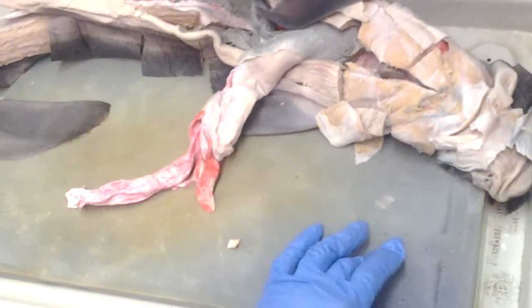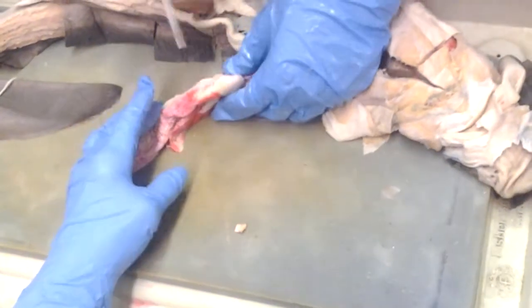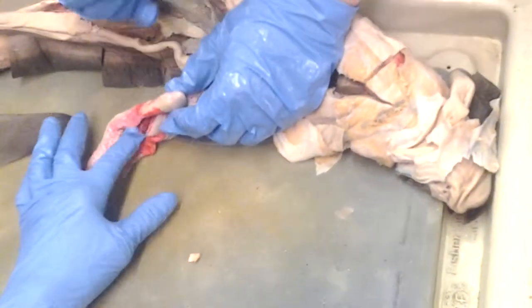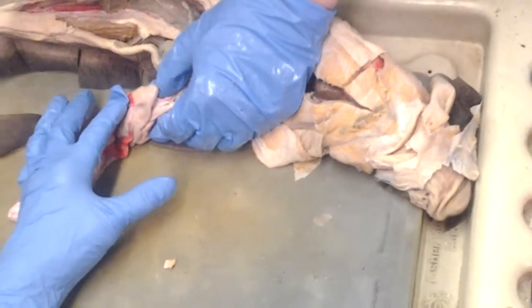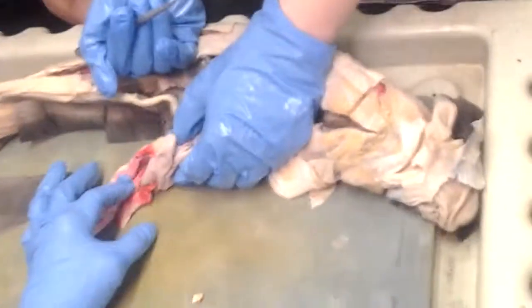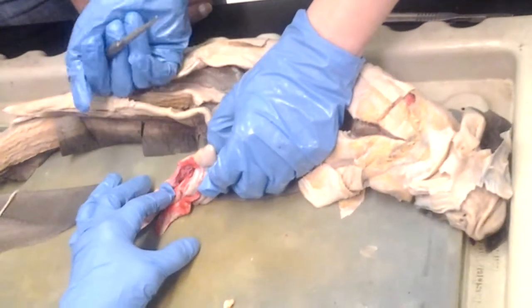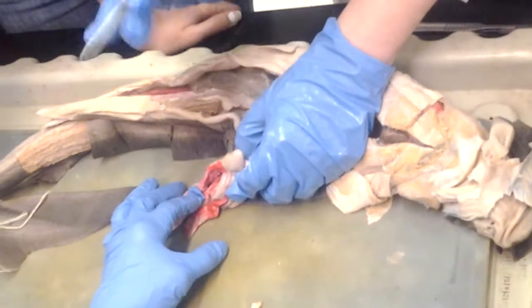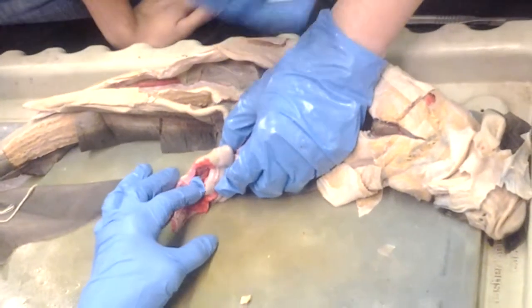Yeah. No, but the pancreas. The pancreas on the stomach, not on the intestine. Well, the pancreas is on top of the intestine. The pancreas is on top of the duodenum. This is the ventral lobe of the pancreas. Yes, right. This is the dorsal lobe. So what's the isthmus? You can't see the isthmus. It connects the dorsal and the ventral lobes.